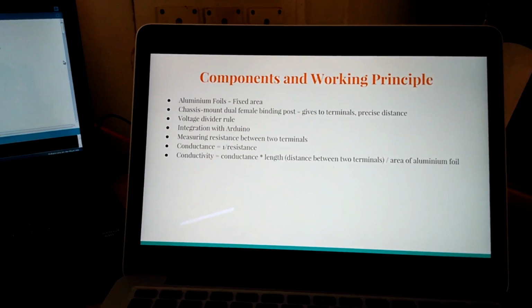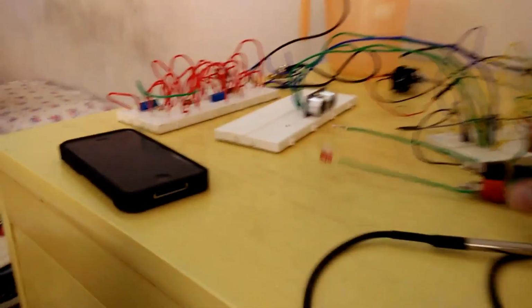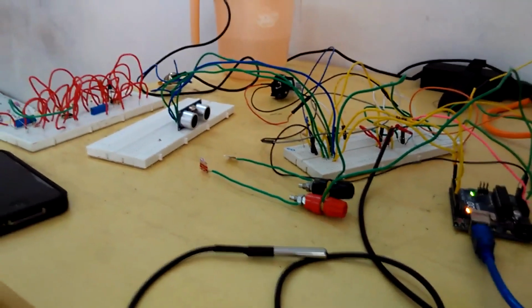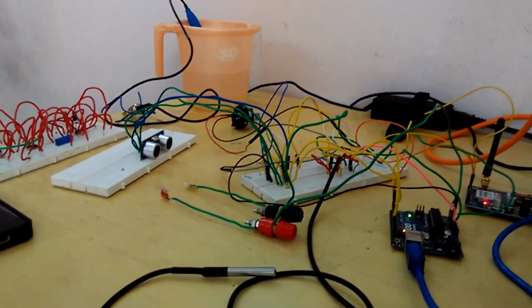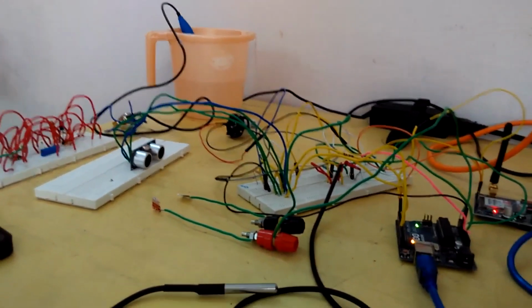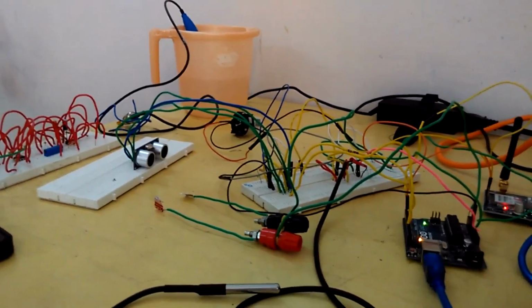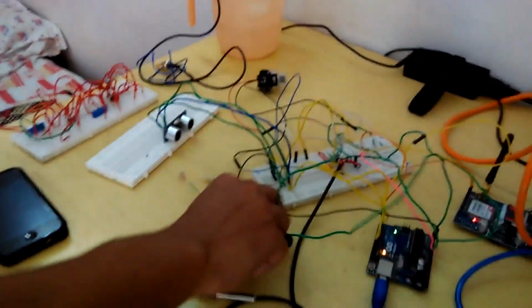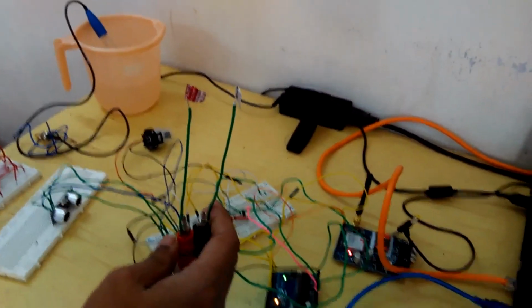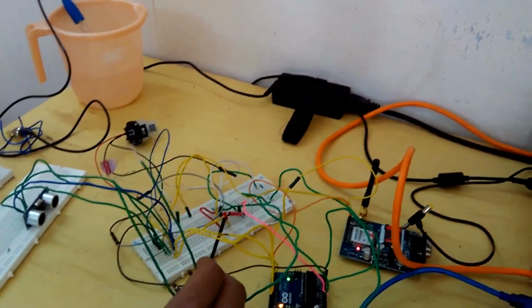So it basically works like a capacitor. A voltage is developed when we dip these aluminum foils, which have an approximate square area, in the sample. Some potential is developed across it, and because of the resistances which we have attached in the circuit, there's a voltage divider relation, and so the voltage which is captured between the two areas gives a corresponding value depending on how conducting the solution is, so the amount of ions which are present in the solution. And so that is how we map conductivity to a specific voltage.